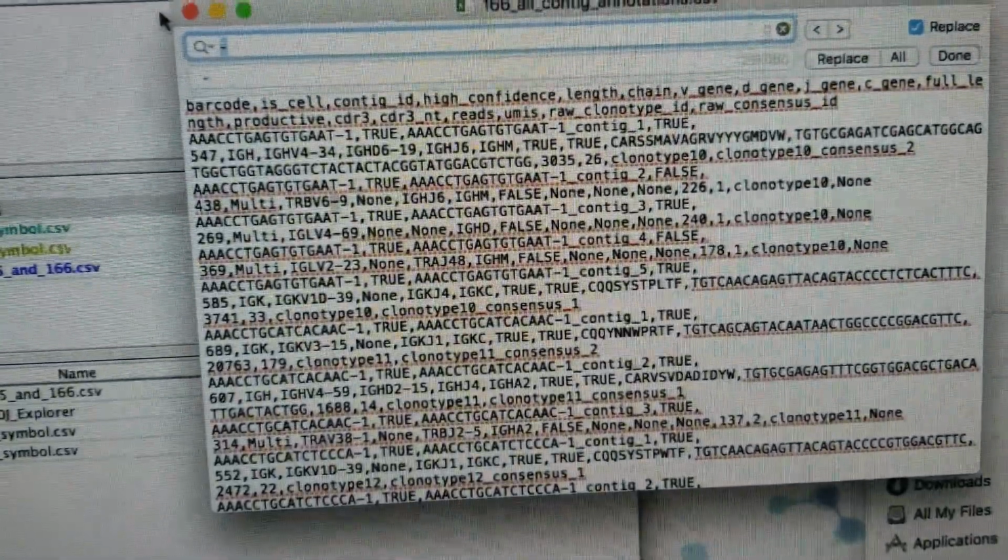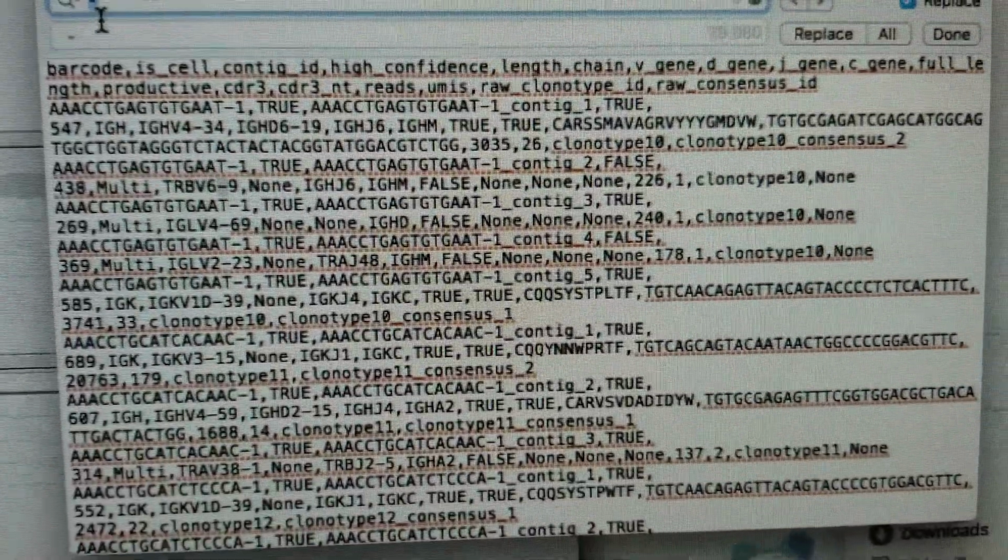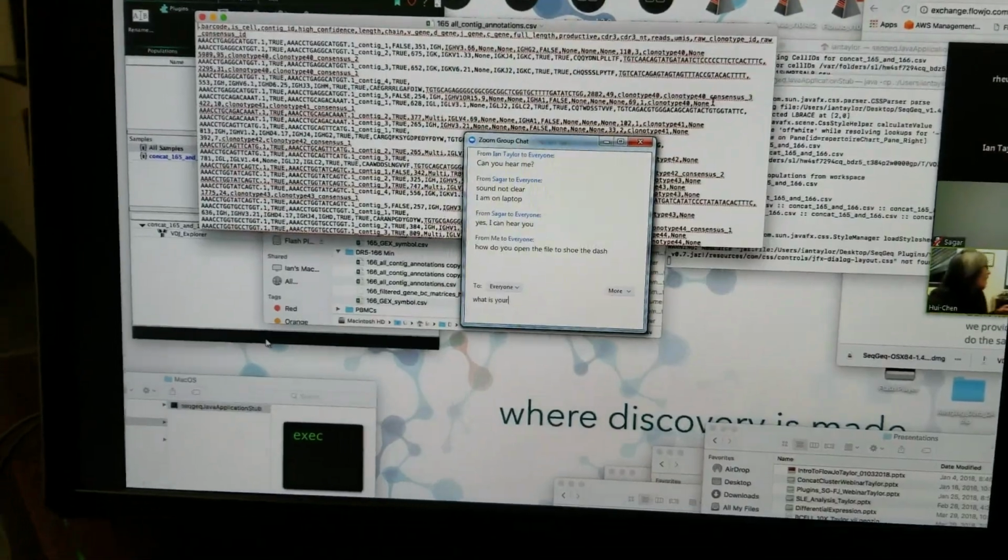So substituting any dashes that we find with dots.